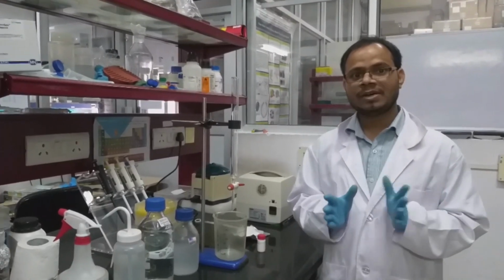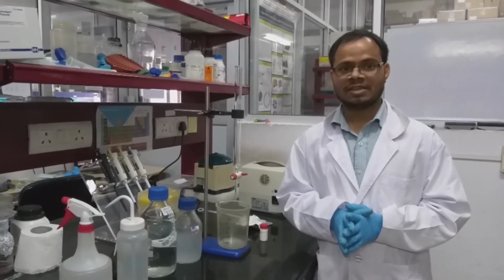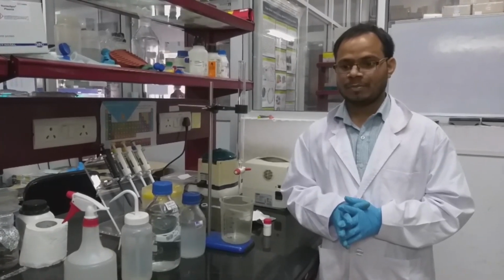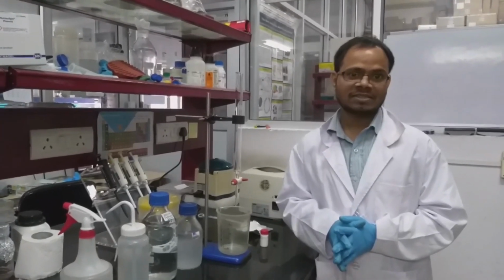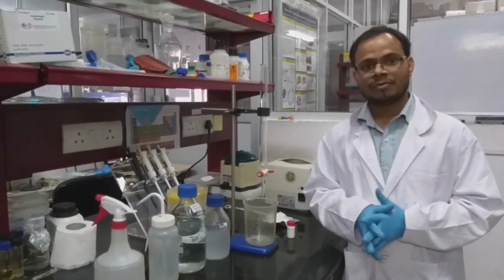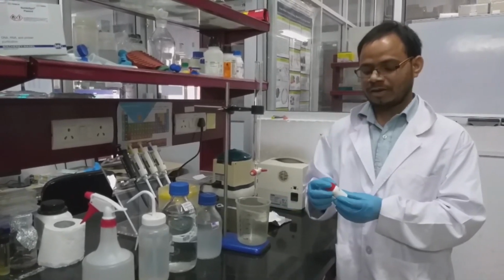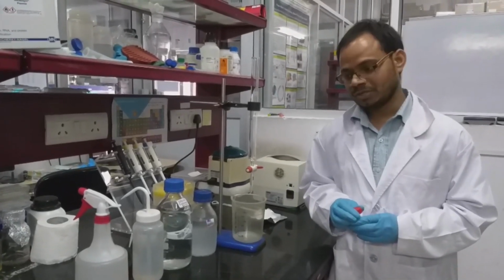What is gel filtration chromatography? There are two phases in this process: one is the stationary phase, another one is the mobile phase. The stationary phase is mainly a cross-linked matrix. For example, we can use dextran, another name of which is Sephadex. This is highly cross-linked glucose molecules. Or we can use agarose, which is also cross-linked, or polyacrylamides. But in this video, we are showing Sephadex G75. This is the stationary phase we are using.